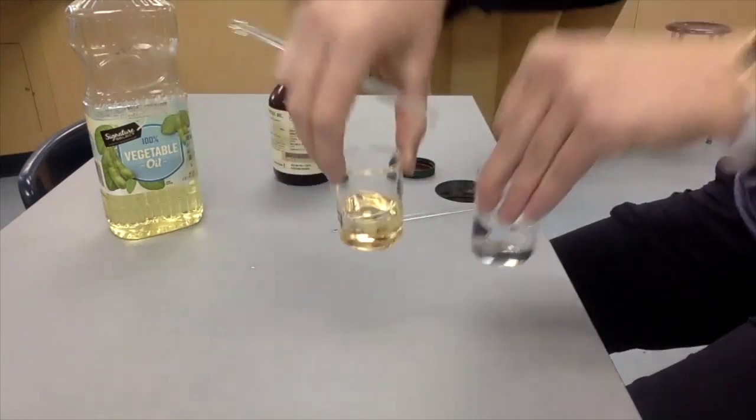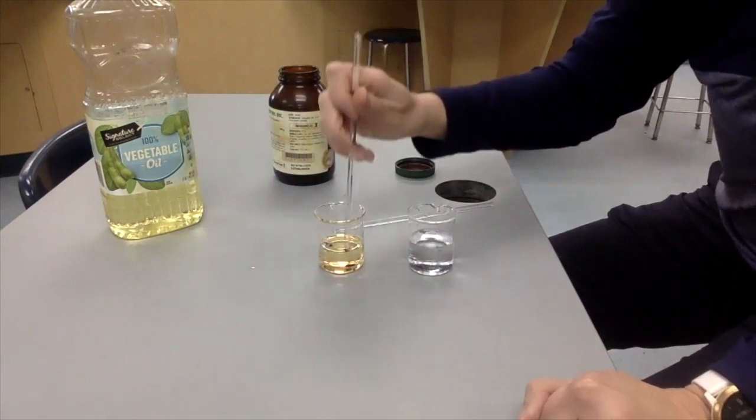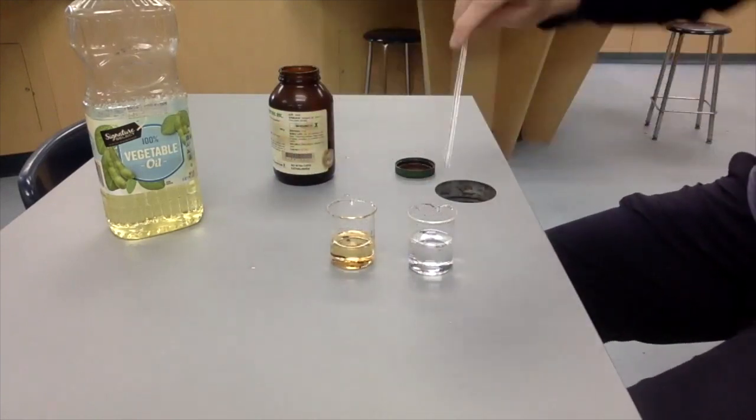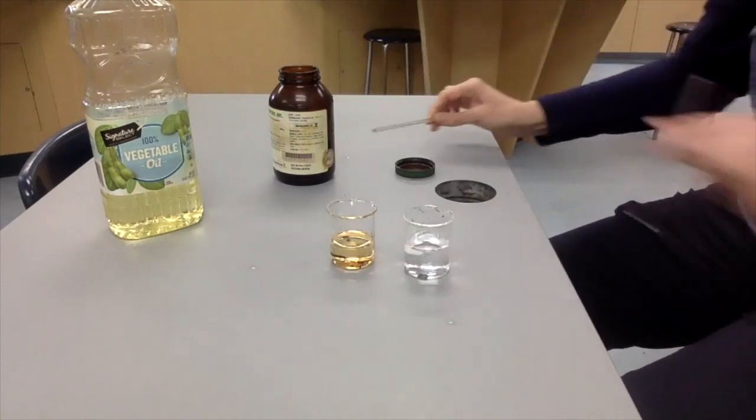Getting a little bit to dissolve in the vegetable oil, but not getting any to dissolve in the water.